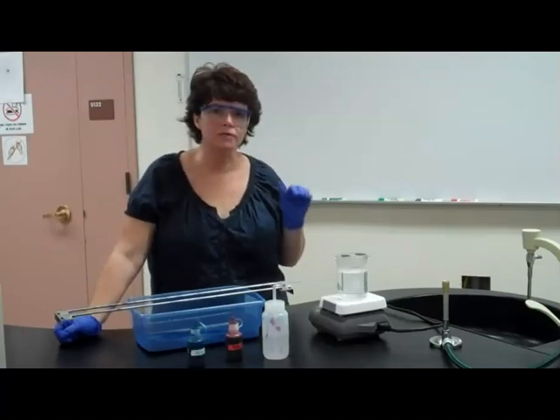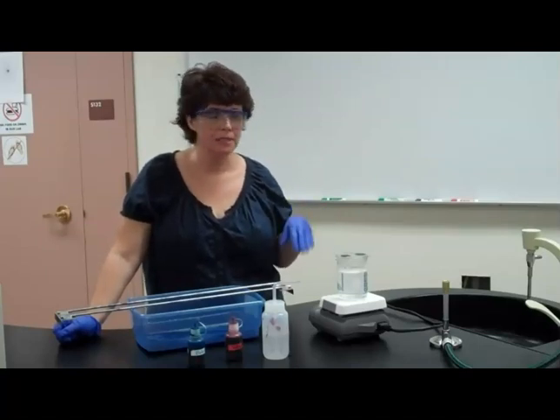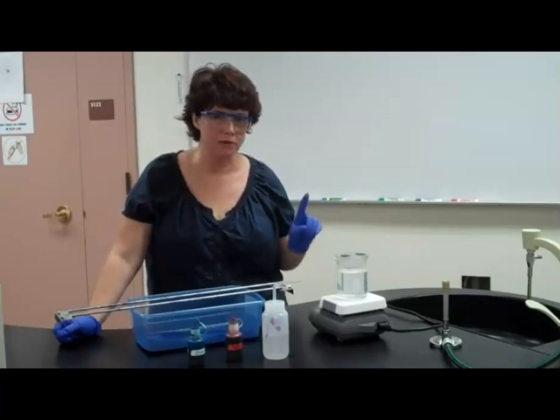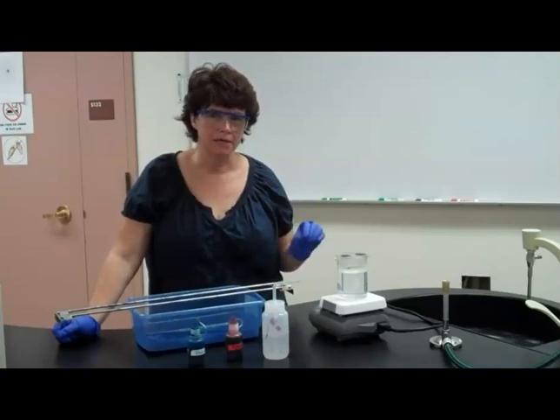The steam allows the stain to penetrate the endospore wall. Once it penetrates the wall, it can't come out. So then when you rinse it, it remains in the wall of just the endospore. The actual cell itself will lose the stain and be colorless.